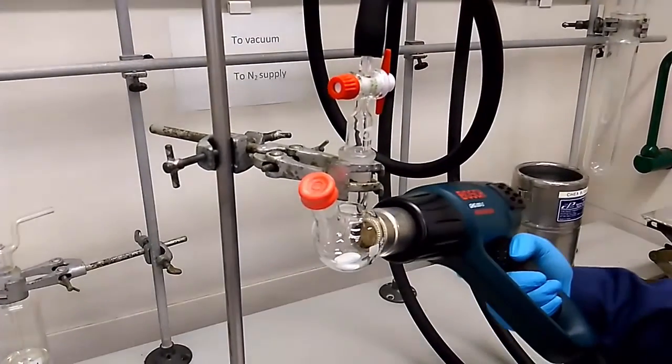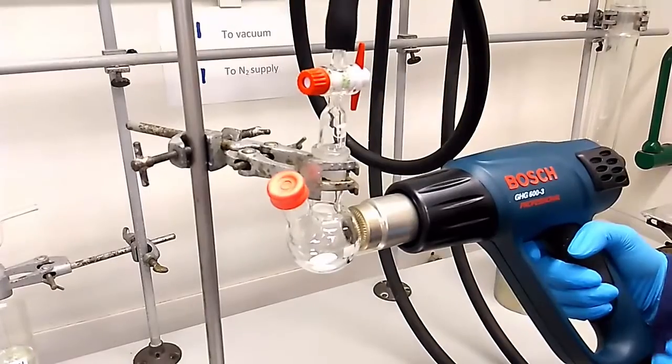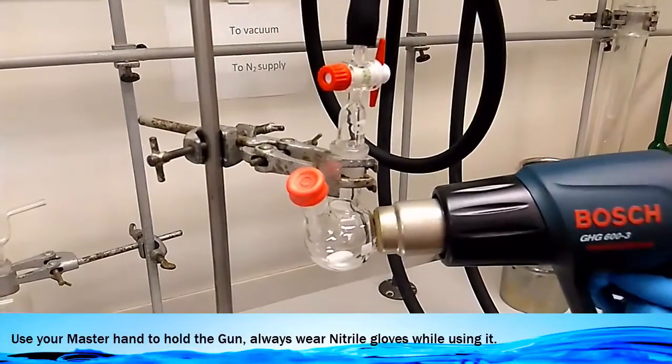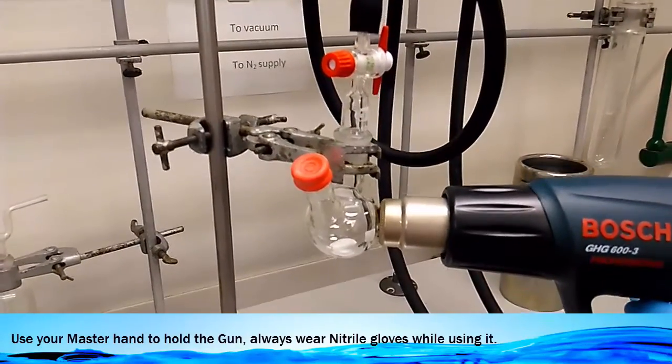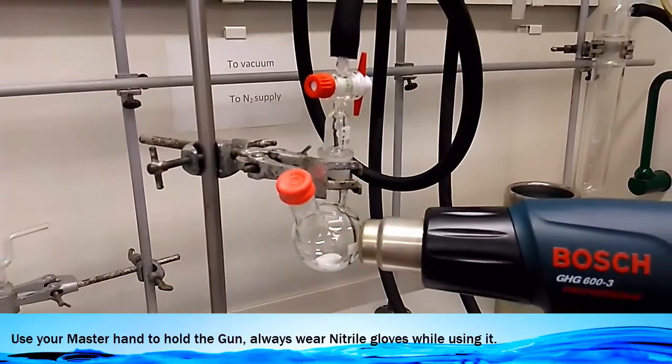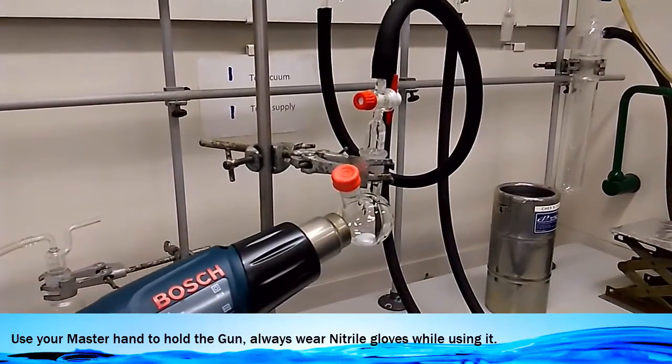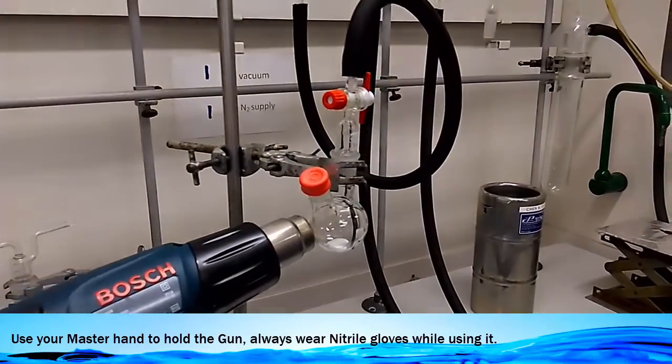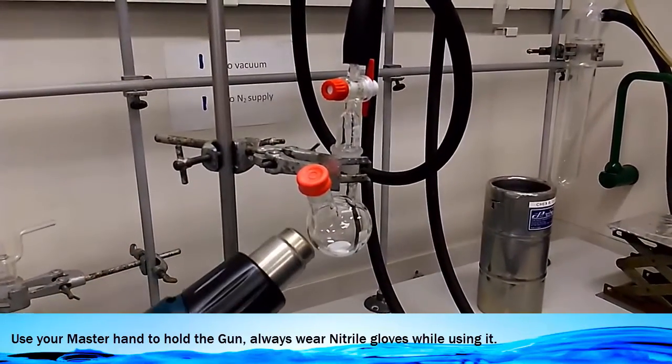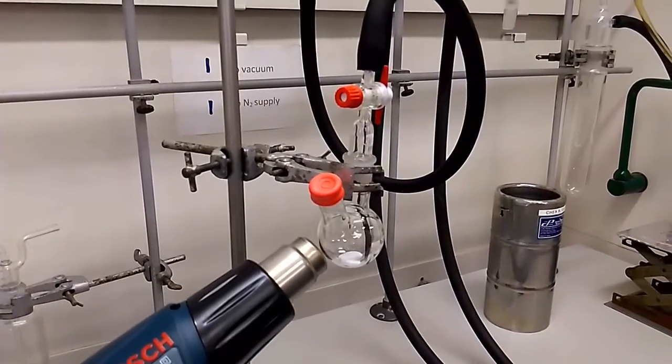Look at that. Be very careful. Use a master hand to hold your gun especially. You don't have to use a right hand. I'm doing it because we have right hand as a master hand. Right?